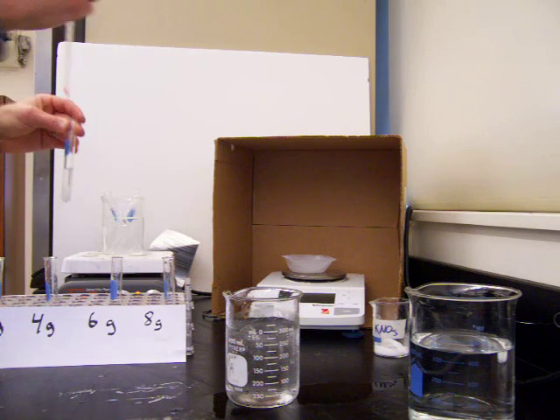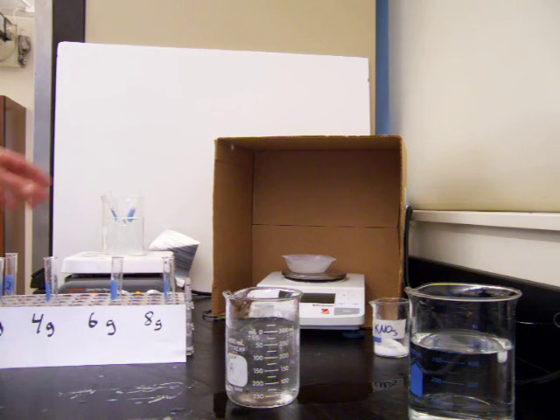If we heated this back up, we could get the solutions to go back into solution. Next we'll do the one with four grams of salt.